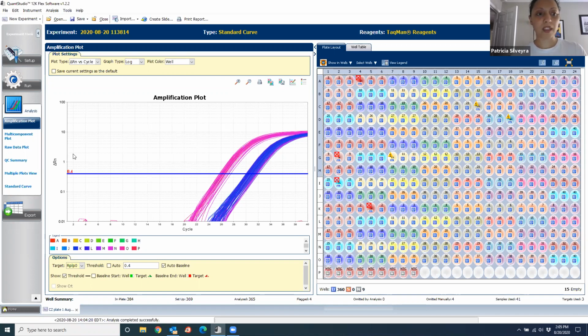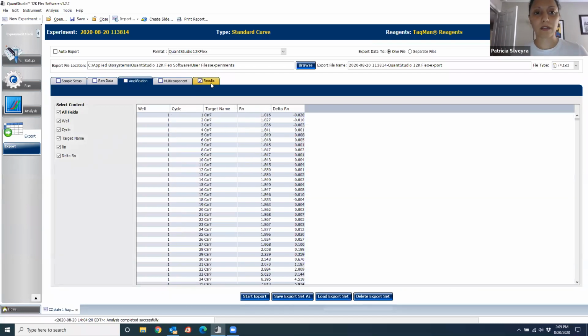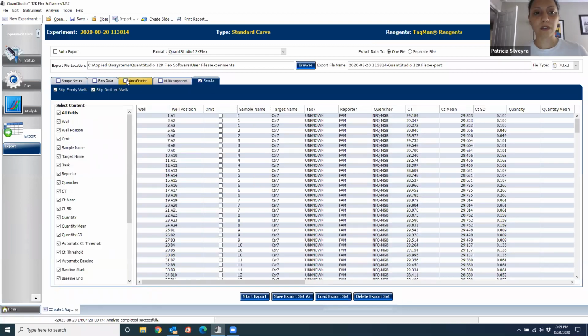So now how do we get that out? We go to export here, and you see here everything in a tabular form. And you don't need everything here. What you do need here is only what is in the results tab. So as you can see, I unclick everything else because I don't want it. I only want the results table. The results table is going to tell me which well, what sample, what target, and what is the CT value, which is what you want.